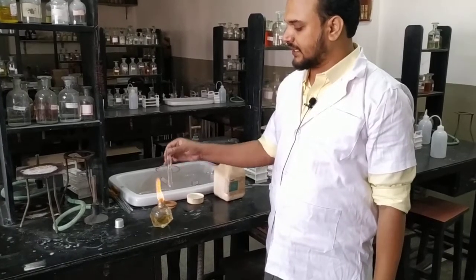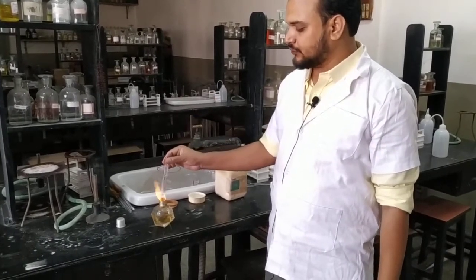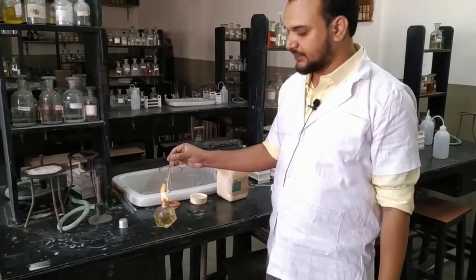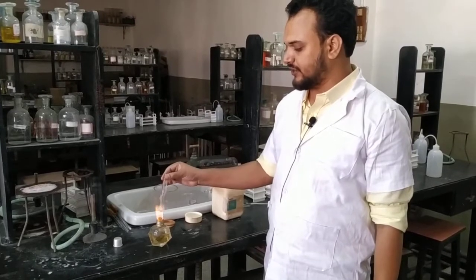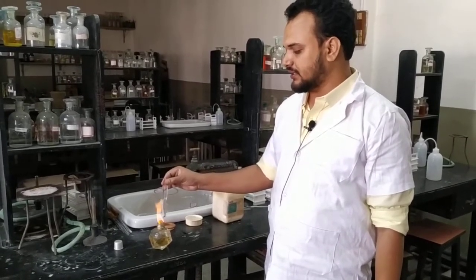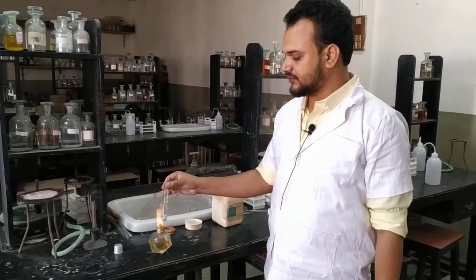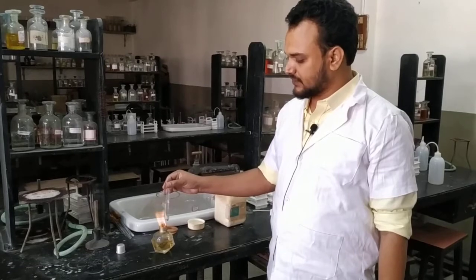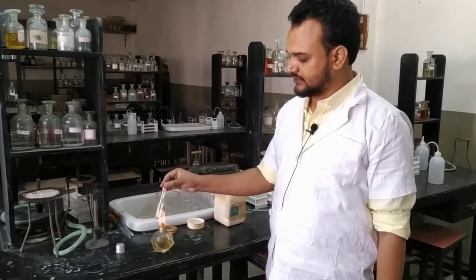So first, we take an aqueous solution of ferric chloride and then neutralize it with either sodium hydroxide or ammonium hydroxide, and a little bit of precipitate comes. We filter it, and that filtrate is nothing but neutral FeCl3. In your exam, neutral FeCl3 is supplied, but I have shown you how you can also prepare neutral FeCl3.